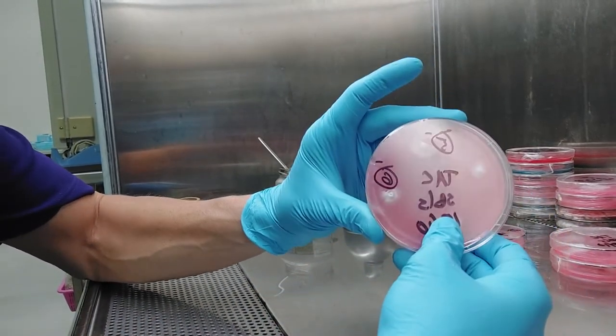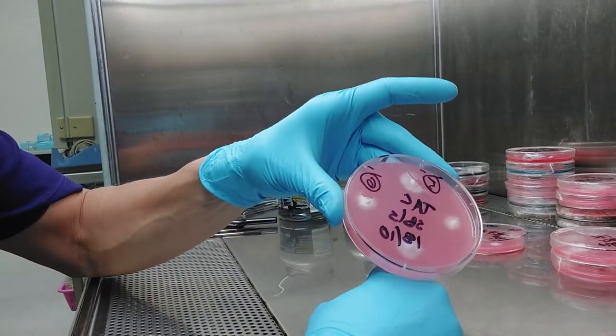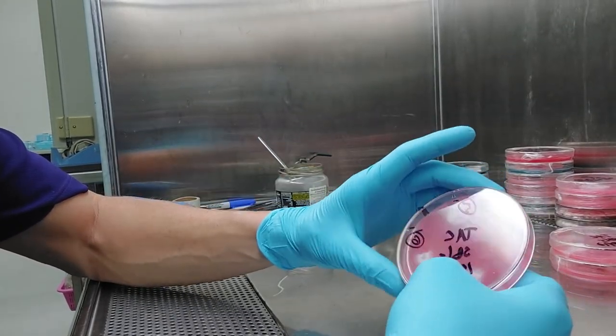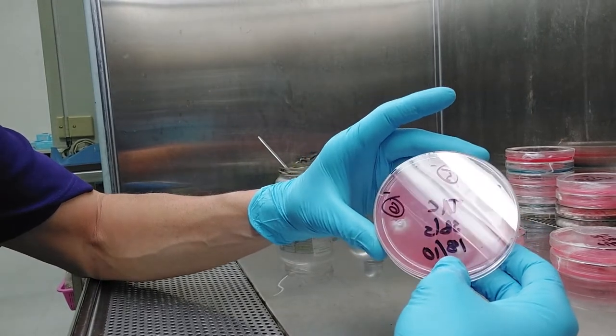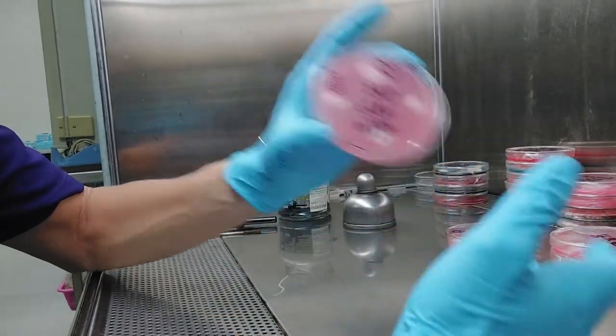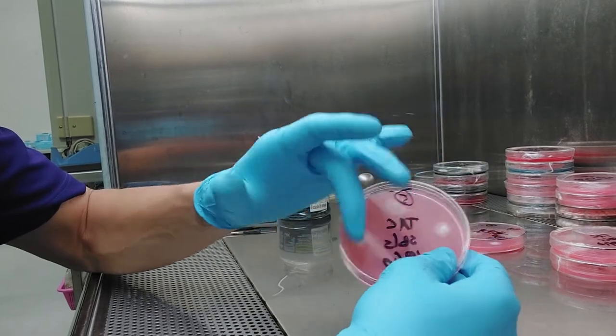So you notice I stopped at six. I'm only really going to use one, maybe two, as a double check of these monocaryon haploid cultures for mating. So in order to save plates and prevent myself from getting a massive migraine headache, I stopped at six. So I got six nice monocaryon cultures from this strain. I still have the spores. If I need to make monocaryons again, this took like a week, maybe, in total.